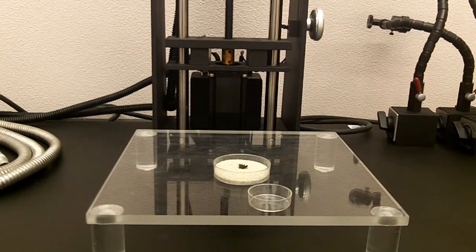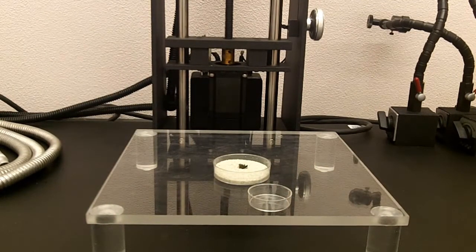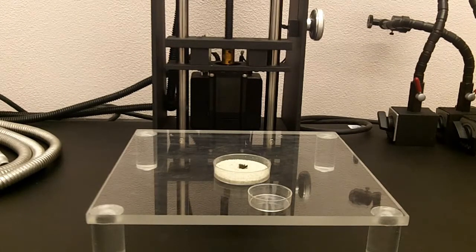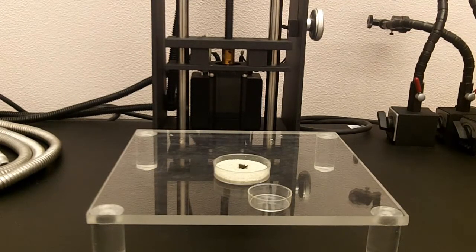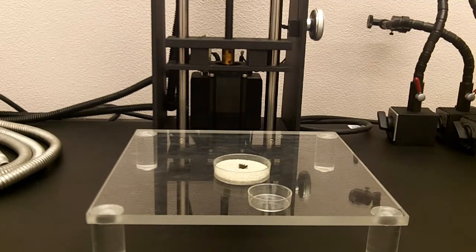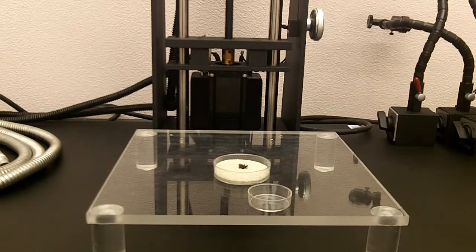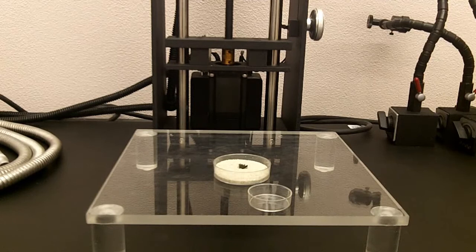Personally, I prefer the sand technique because it's just a lot easier and quicker to situate the specimen. And if you're working with a type specimen that you really don't want any kind of residue on, you do not want to use the gel technique.